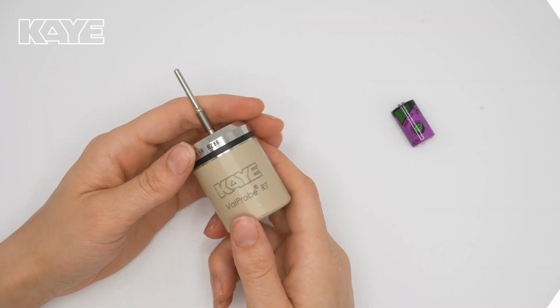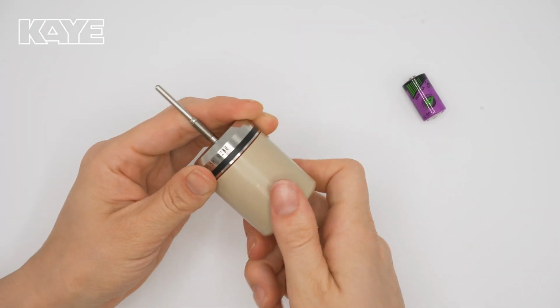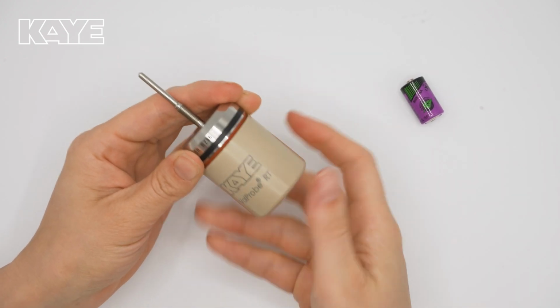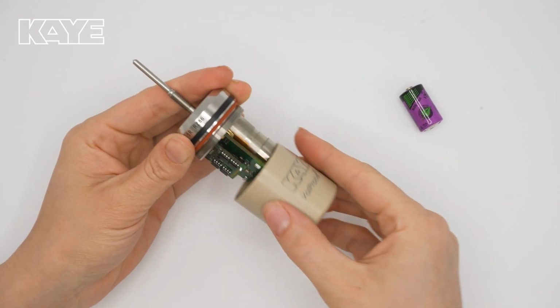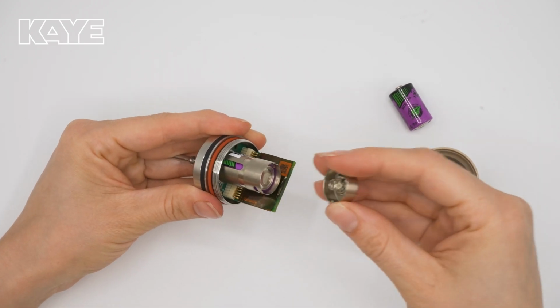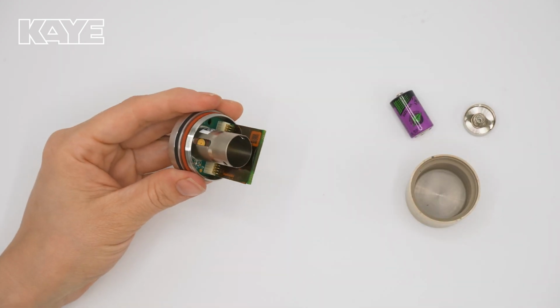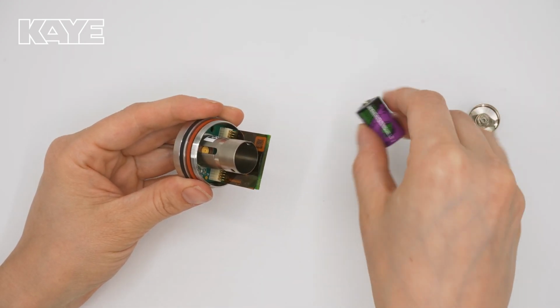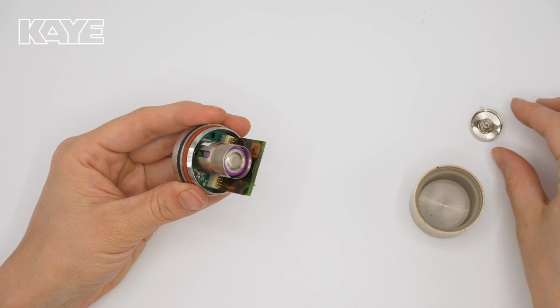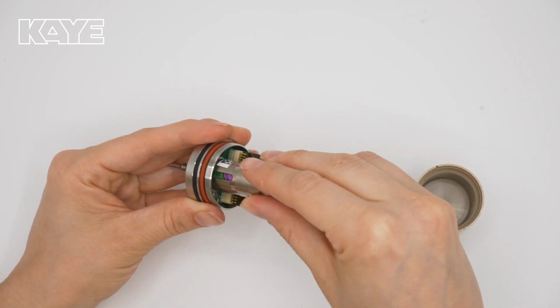We've made replacing the battery on the ValProbe RT easy to do in the field. Simply twist the housing unit counterclockwise. Then, ensuring you don't harm the battery board, remove the spring-loaded battery housing cap by pushing down gently and twisting it counterclockwise. Remove the old battery and replace it with the new battery provided by Kaye. Put the battery housing cap back on by lining it up, pushing in gently, and twisting clockwise.